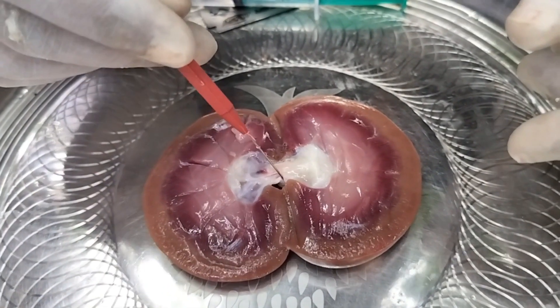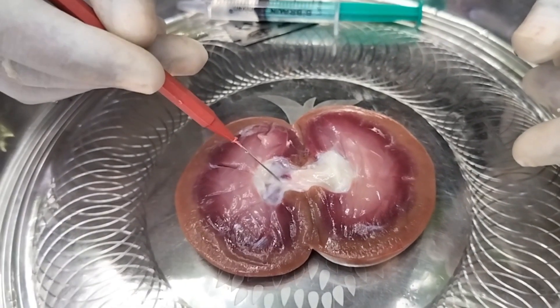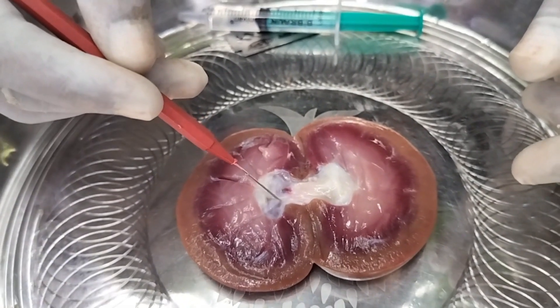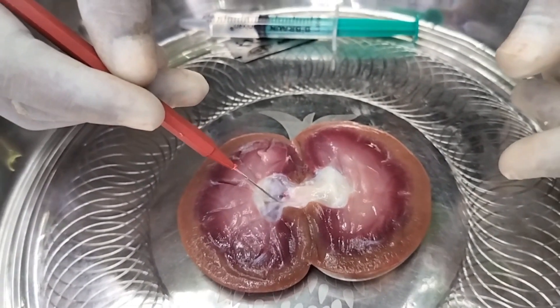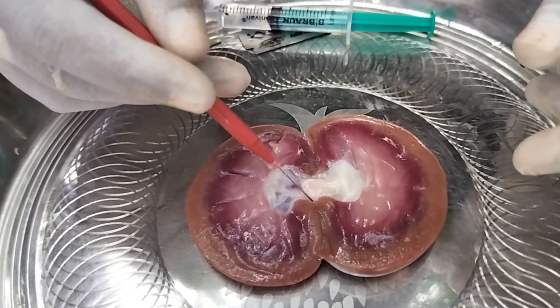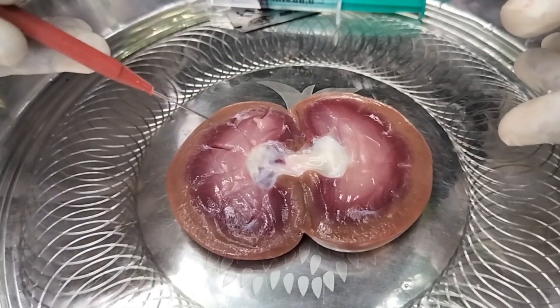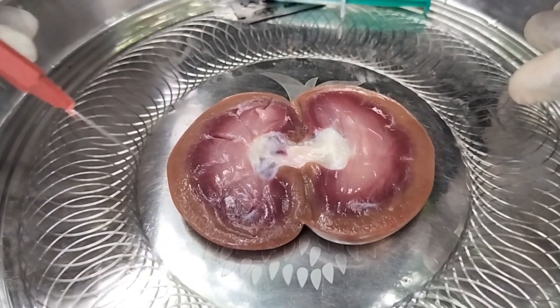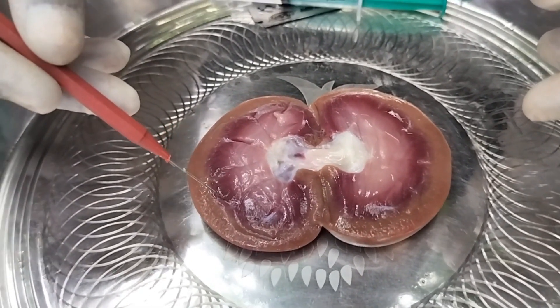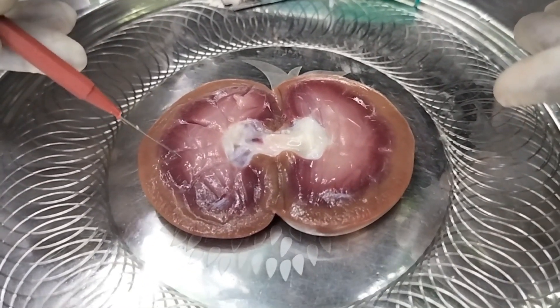You are now observing the pelvis region. Nephrons open into the pelvis. The stripes you are observing on the renal pyramids are nephrons.